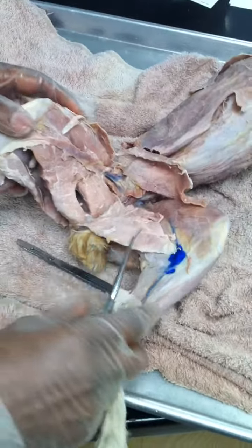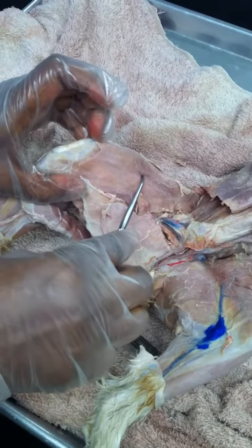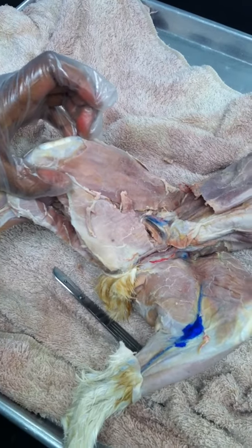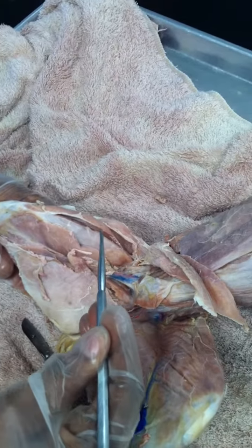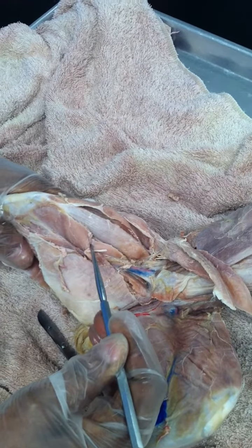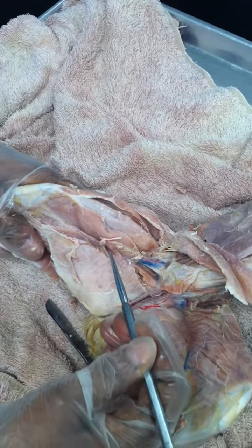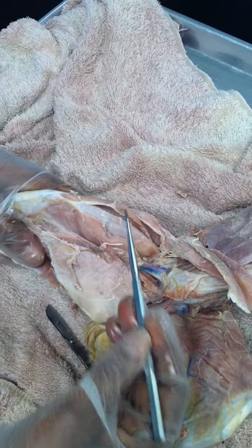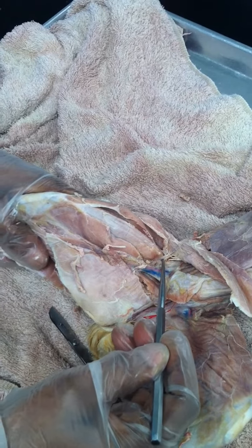And then if I do the flip side, the medial side of the leg, superficial muscles is your sartorius and gracilis. Okay, if you lift the sartorius muscle, you expose the muscles underneath. You need to know 3 of these, and that's your vastus lateralis and vastus medialis. In between them, you have your rectus femoris.